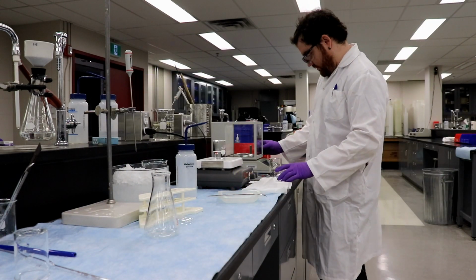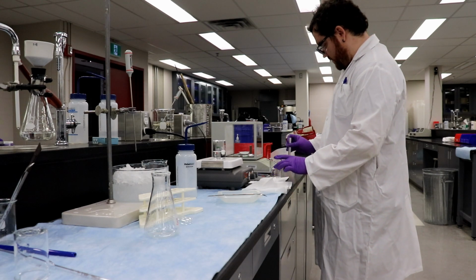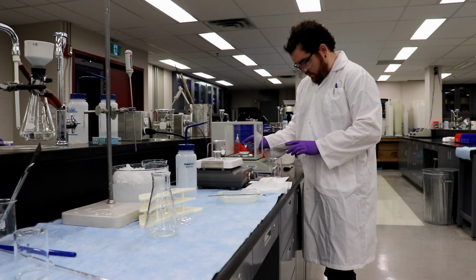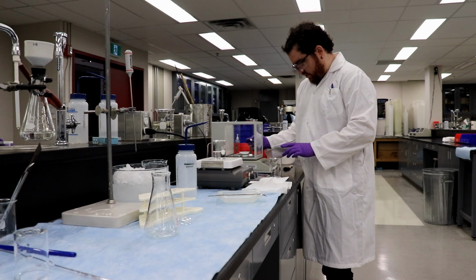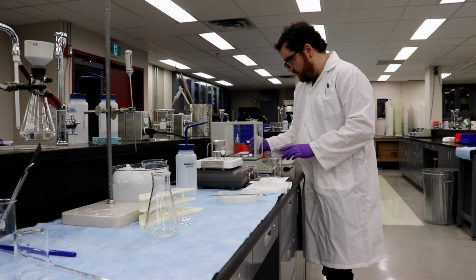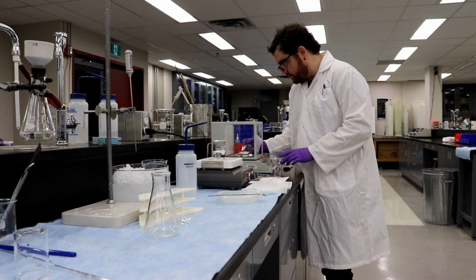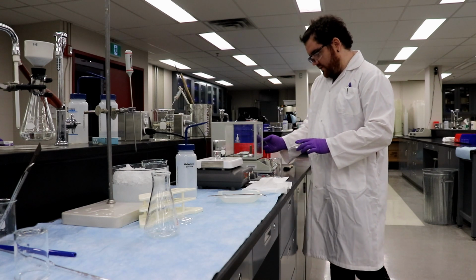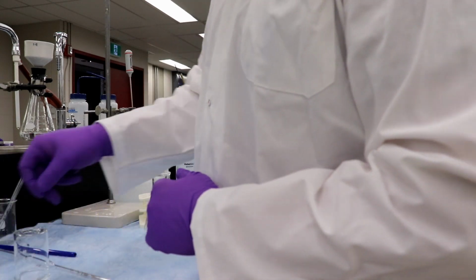So let's head over here now. Okay, putting our weigh boat on. Taring our weigh boat. 1 gram. Make sure to drop half of it on the counter. Very important. You tared before you added the? I did. Okay, and our mass is 1.0054 grams.